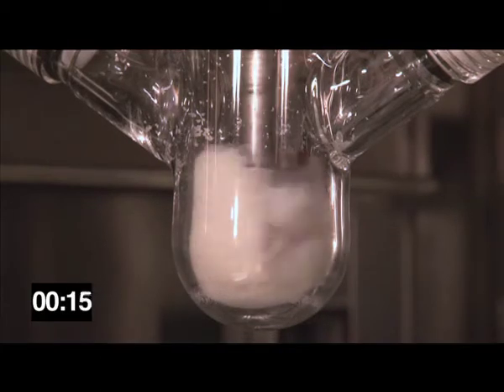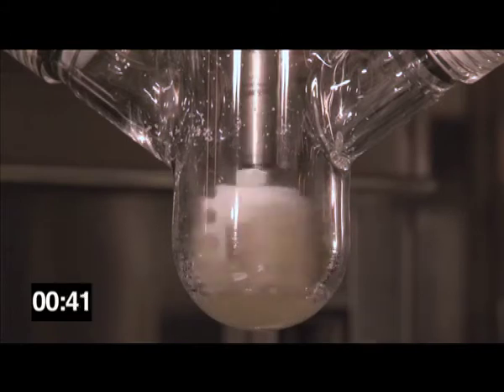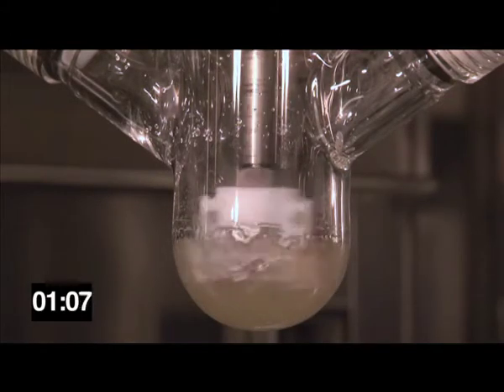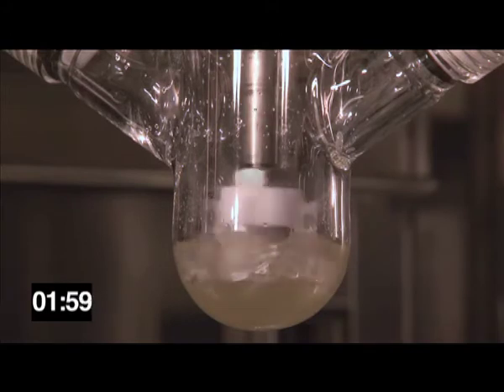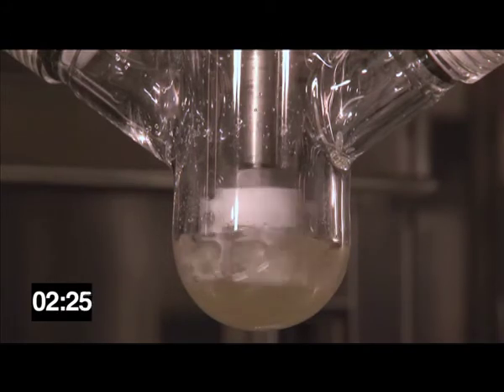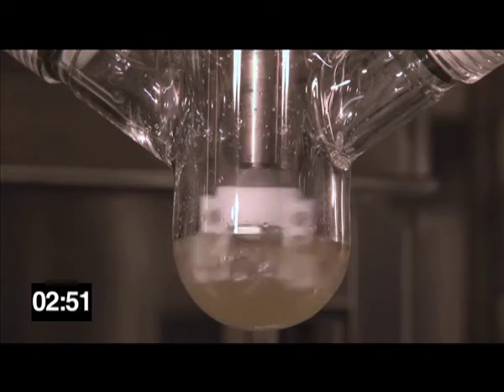As CO2 is added, the solid white material begins to change phase. Within seconds, the material appears wet. By the end of the first minute, it is mostly liquid. Over the next few minutes, the liquid continues to become more transparent.